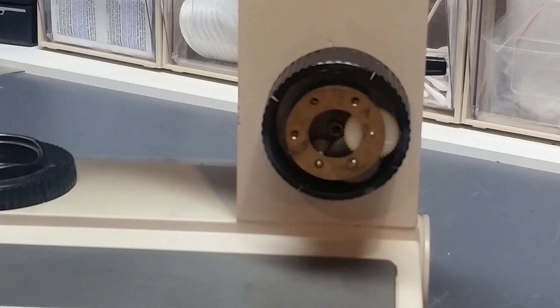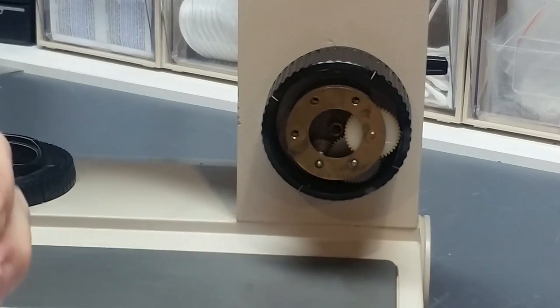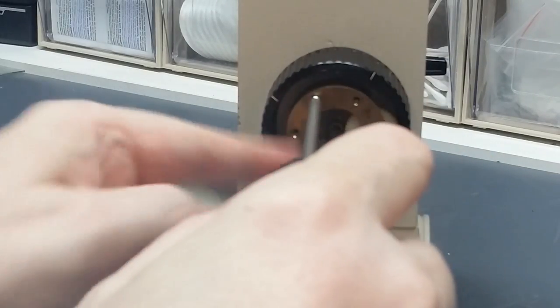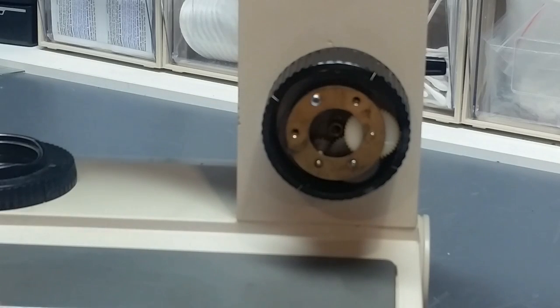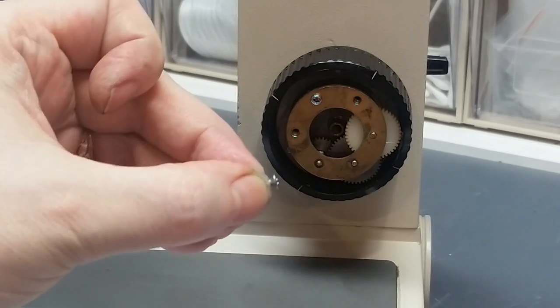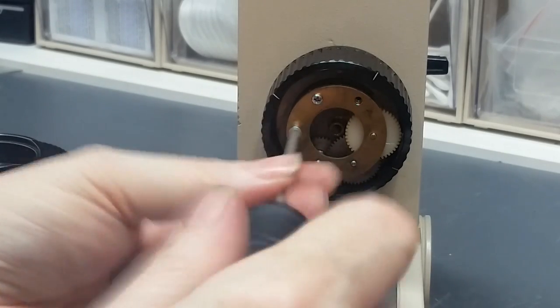Okay, I'm going to start by taking the pan head screw, and I'm going to loosely install it in the middle here, in the middle of these three screw holes. Then I'm going to take two of these countersink flathead screws, and they go in the two outside holes.